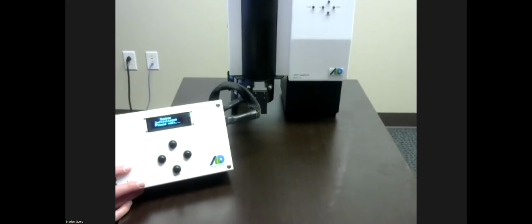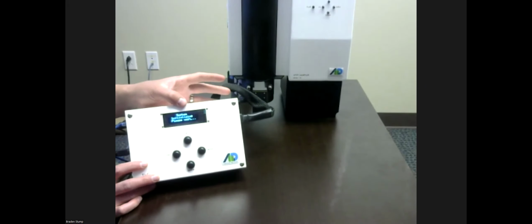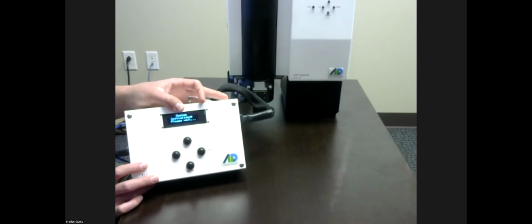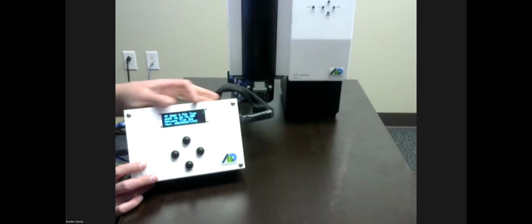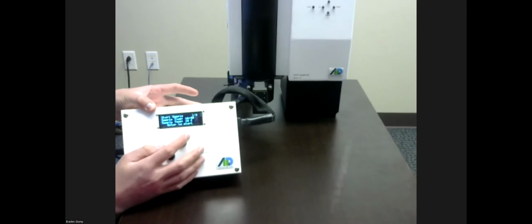You'll start to see firmware version initializing. If it matters to you, and if you're connected via Ethernet cable here, you will be able to see your IP address, which is useful to potentially take a picture of. And then these units also have a real-time clock now, so you will be able to see when the real-time clock is updated because it is connected to the internet, to its new network time set here. You're seeing Ethernet port, network time set. So now you're seeing options for starting sample, a sample time, a sample temp, and then enter to start.